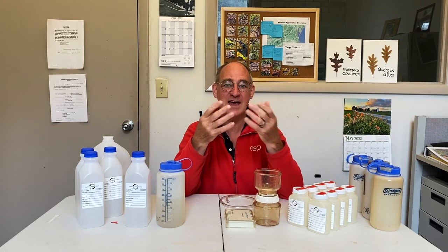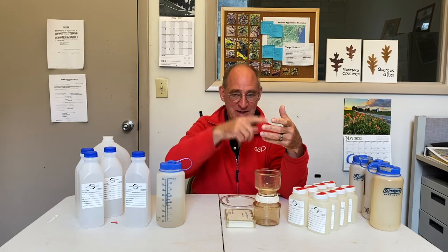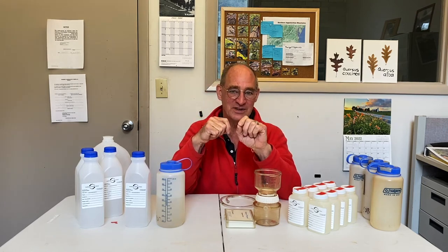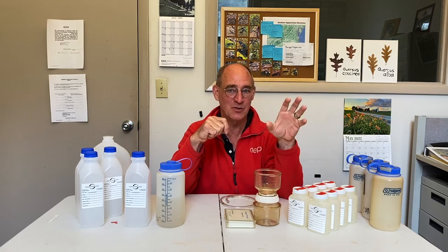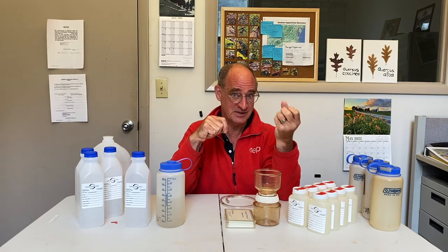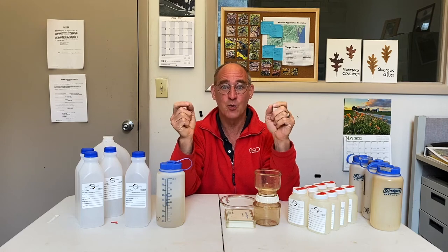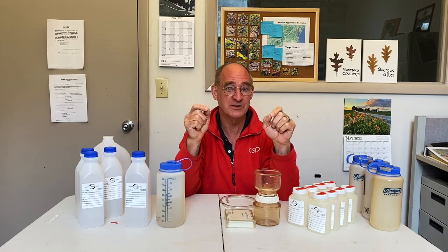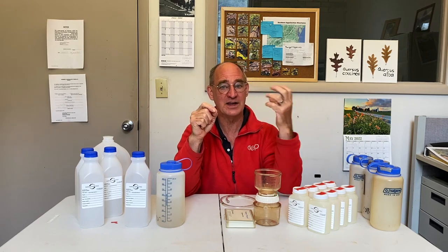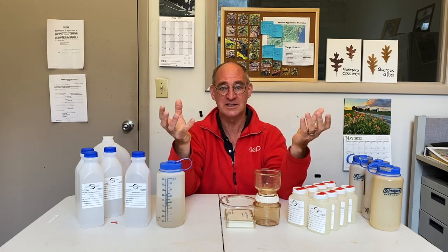So for instance, if I had an iron oxide mineral in the water, and I kept adding H+, the pH wouldn't go down as fast, but it would dissolve some of that iron mineral into the water, and some of the acidity would be contained in the dissolved iron, and some of it would be contained in the H+. So one of the reasons we filter is to know how much dissolved iron there is, and then we can add the dissolved iron to the H+ and calculate total acidity.